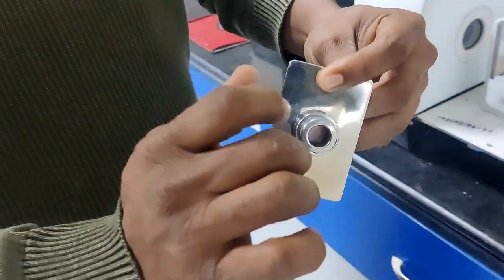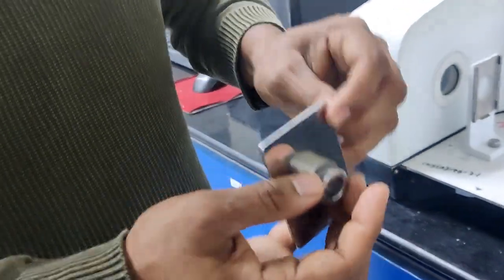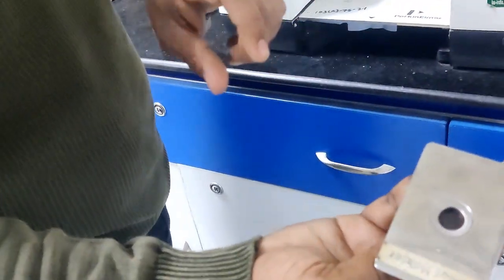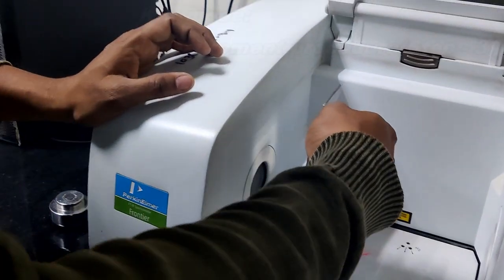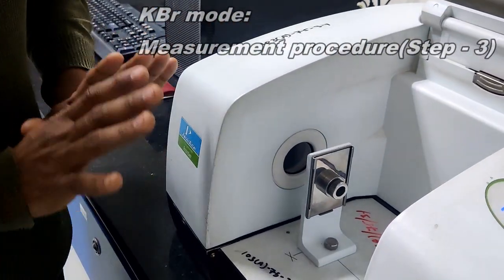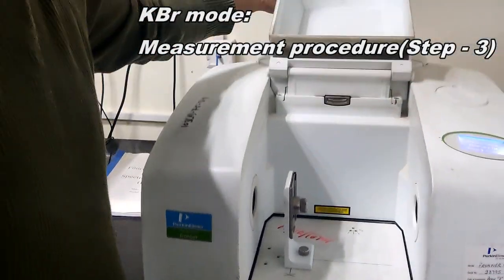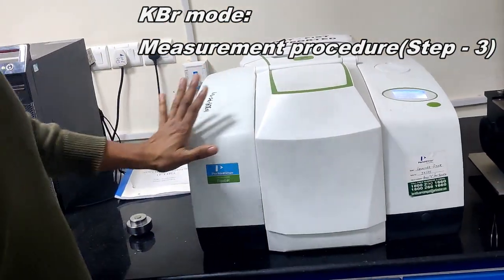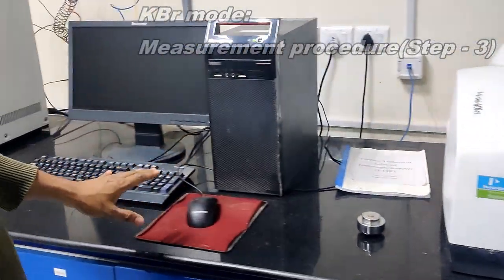We should not fix it tightly. We have to fix this screw slightly. After keeping this, you can see here this is the prepared pellet. After that, I am keeping it inside the slide holder. Now I'm done with keeping the pellet inside. I'm closing this cover. After closing the cover, we have to come to the software.